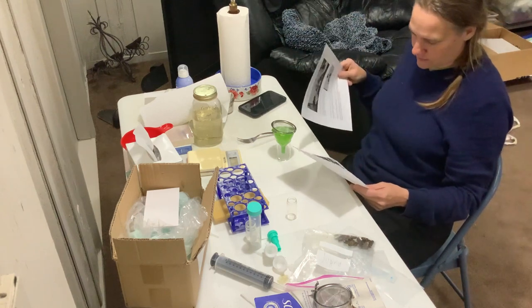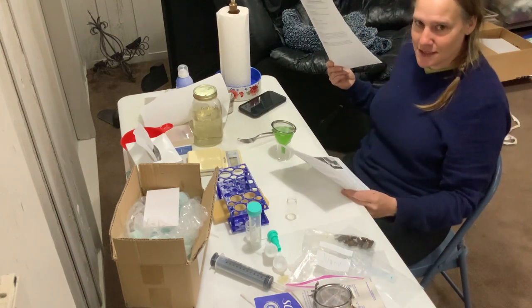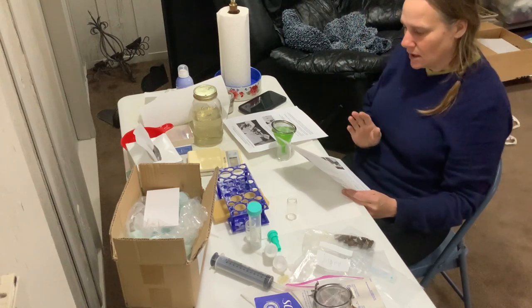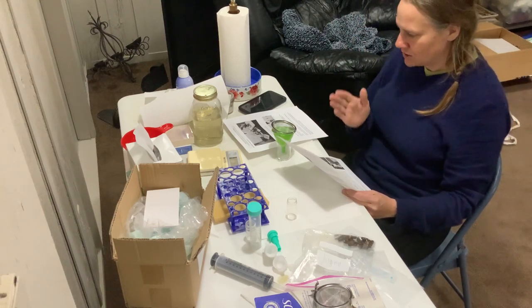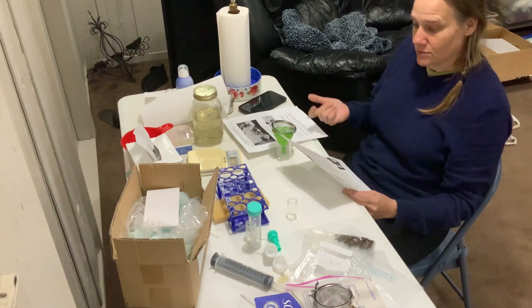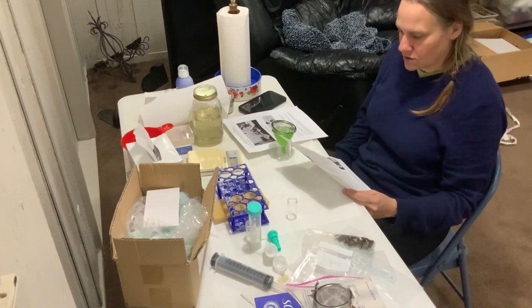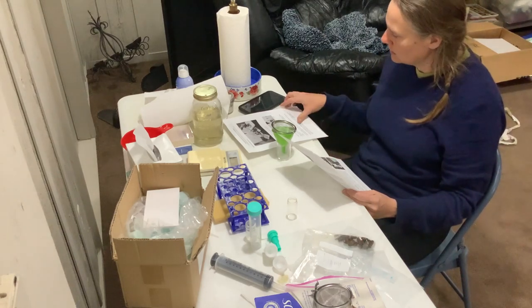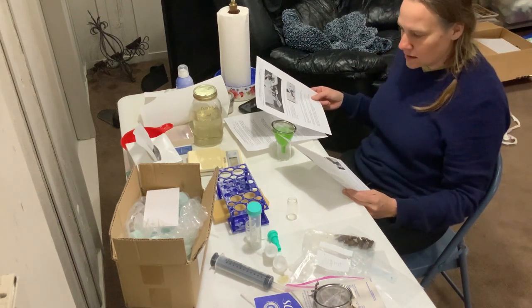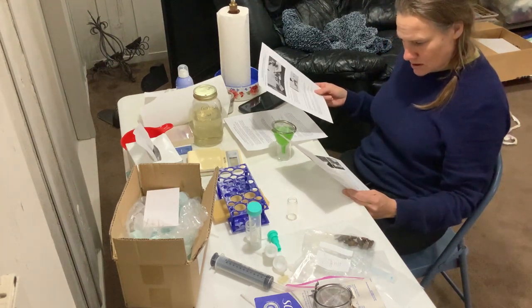She was trying to gobble up the power punch last night — she wanted to take the syringe out of my hand. I've been giving Audrey an ounce every morning and night pre-lambing, and then the mom sheep I had discontinued hers post-lambing. When I was going through her pen to give Audrey hers, she grabbed the syringe out of my hand. So I went ahead and gave it to her and checked her FAMACHA and it was low. So I guess my new indicator is if they try to grab the power punch from your hand, you might want to check them. This is the procedure for doing the McMaster's fecal.